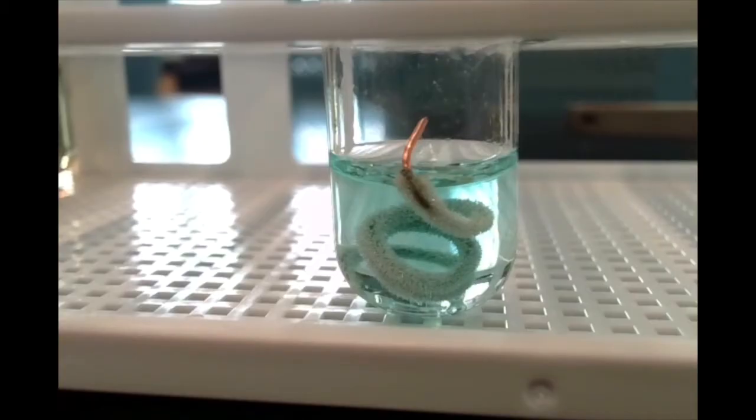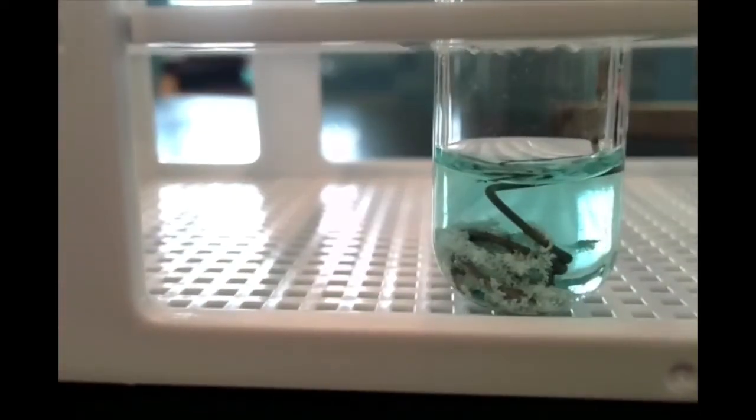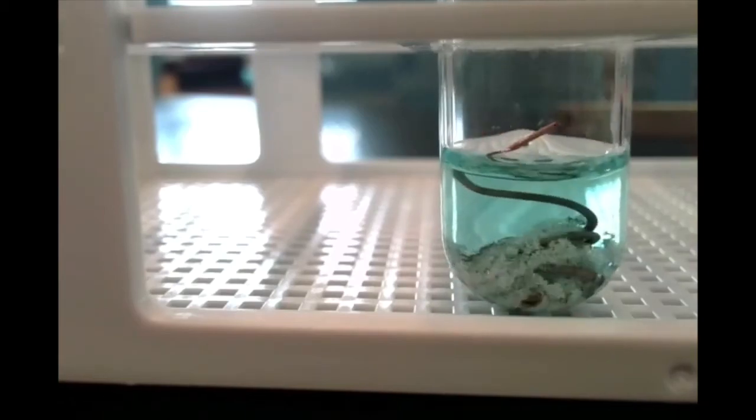And at this point, you can really see the flakes of silver sort of making that copper wire look furry and obviously silvery colored instead of coppery in color. Okay. If I give the test tube a little shake here, you're going to see those silver flakes come off, those silver needles. At this point, you can see them quite clearly on the copper wire. I'm going to go ahead and give this a little shake, and you can see the flakes come off. There you go. You can see the little silver flakes.